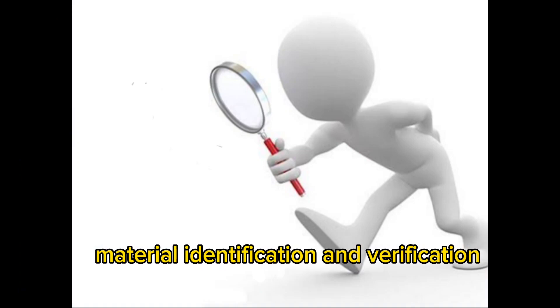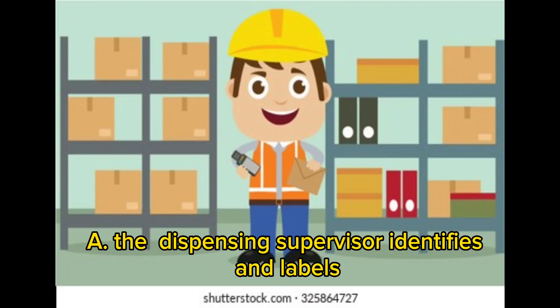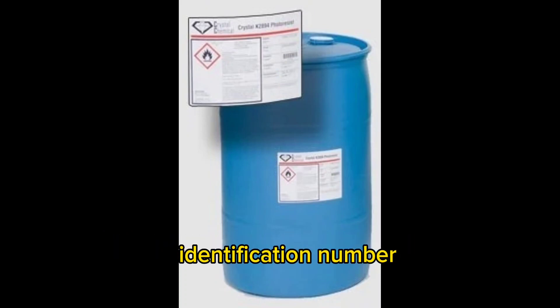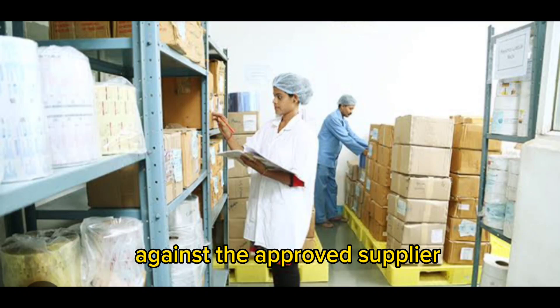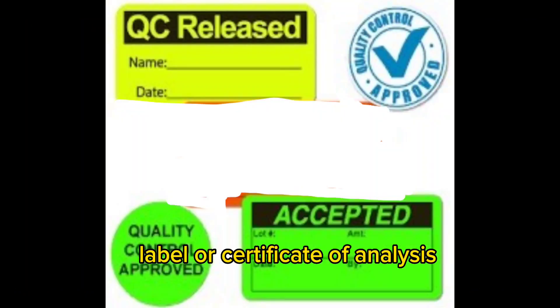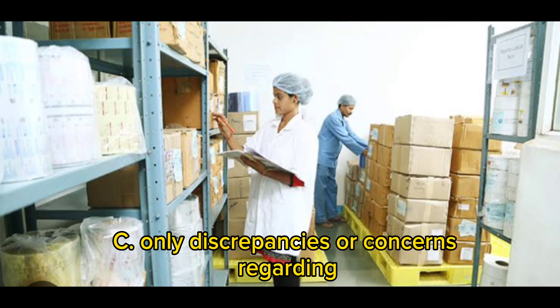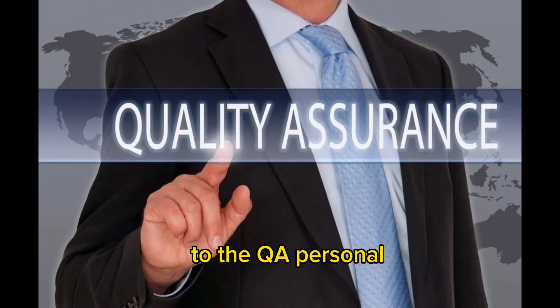Material identification and verification: The dispensing supervisor identifies and labels each raw material container with a unique identification number. The identity of each raw material is verified against the approved supplier label or certificate of analysis. Any discrepancies or concerns regarding material identity are immediately reported to the QA personnel.